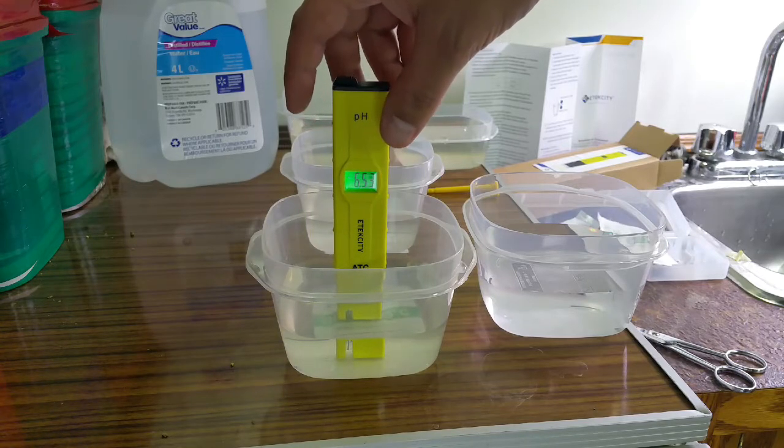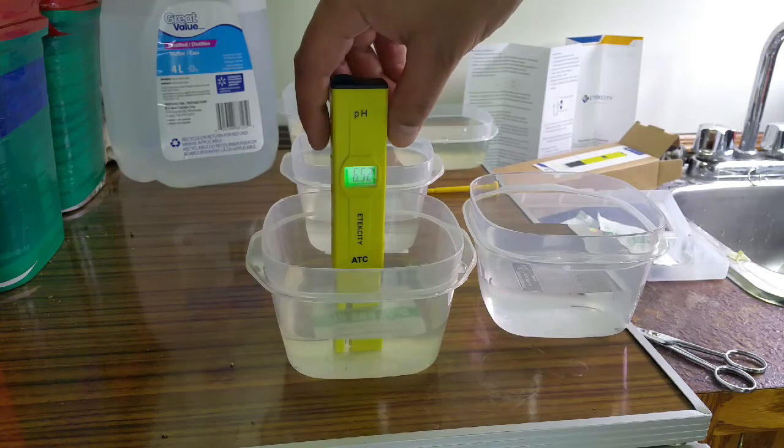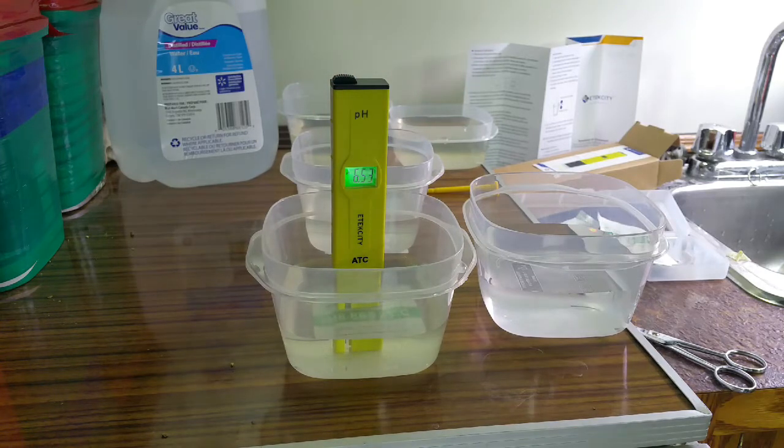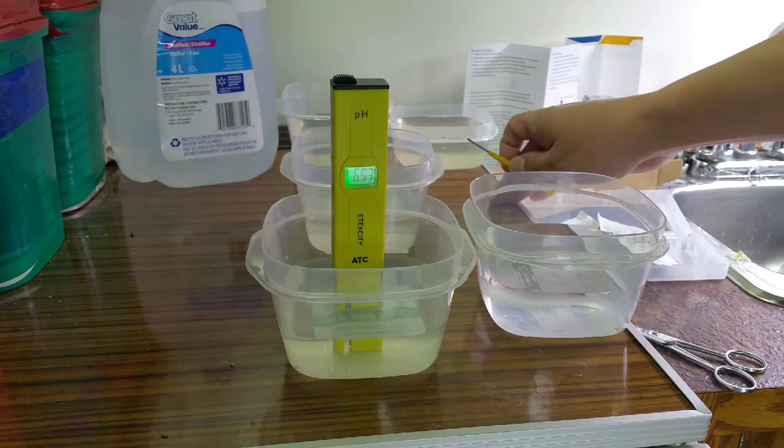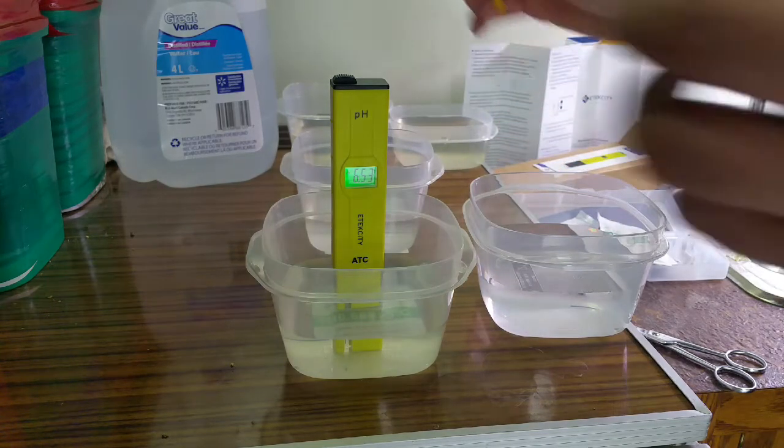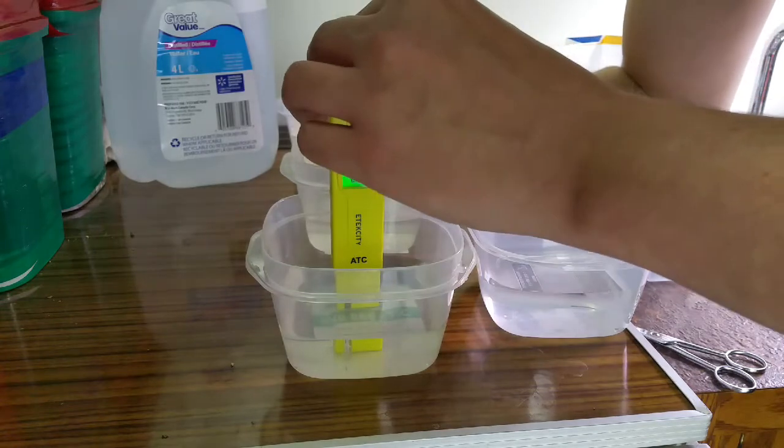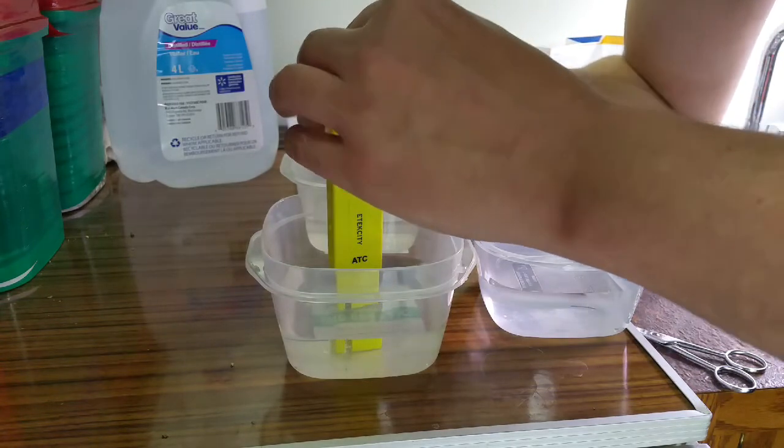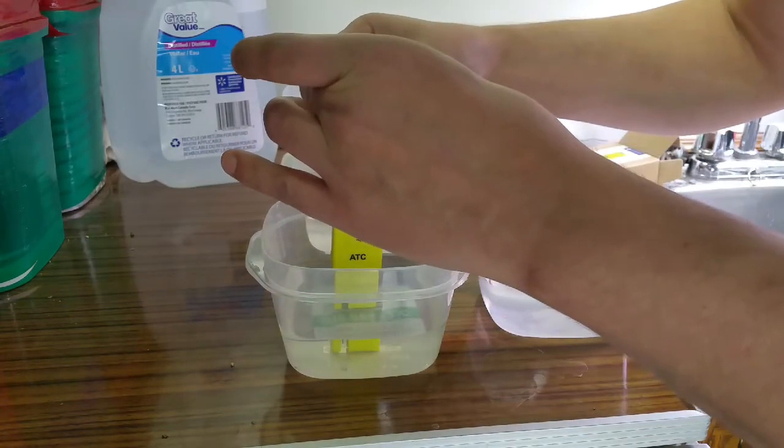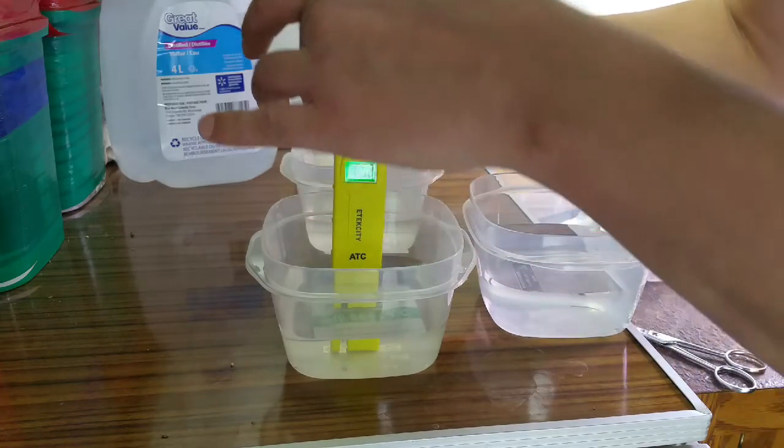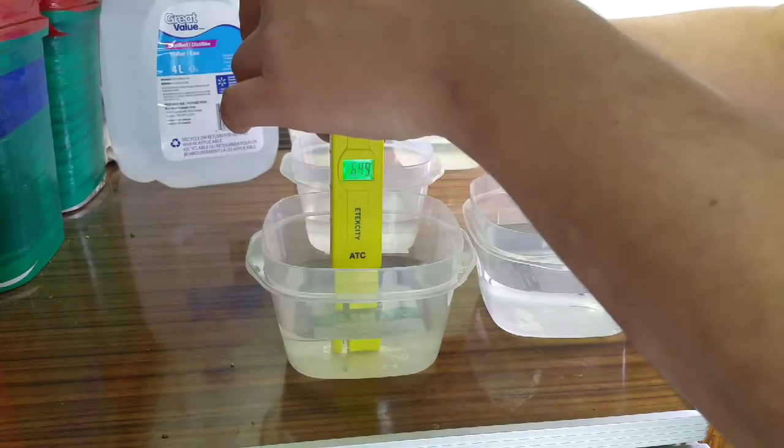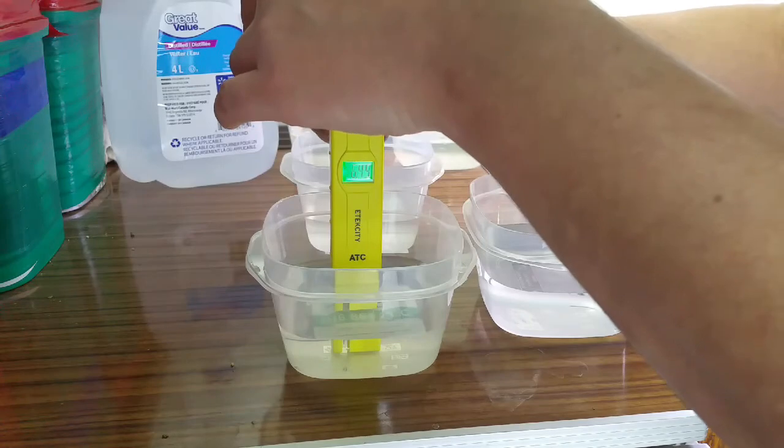It's supposed to be 6.86. That's at 6.53, so there's a calibration screw on the back here and I'm going the wrong way.